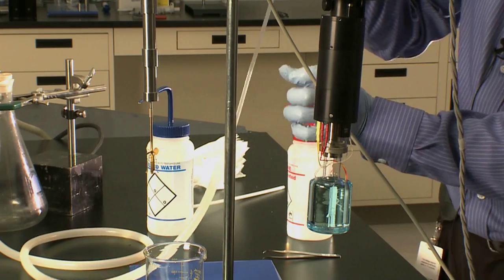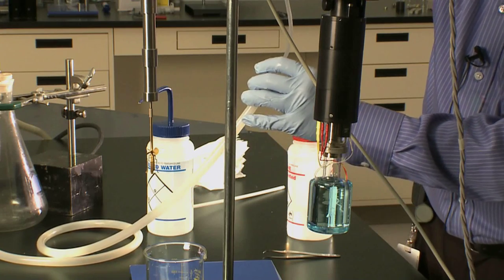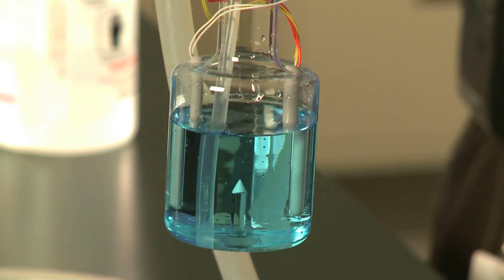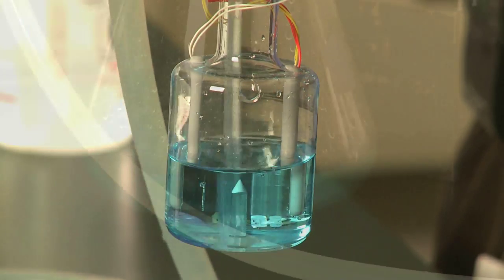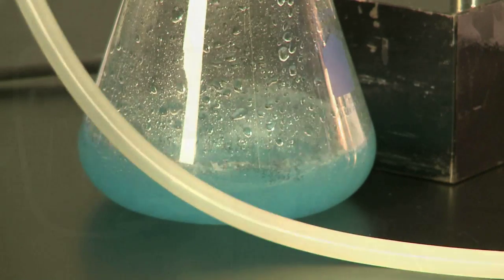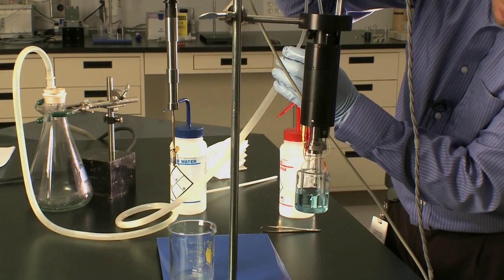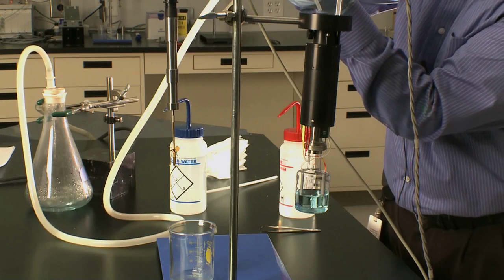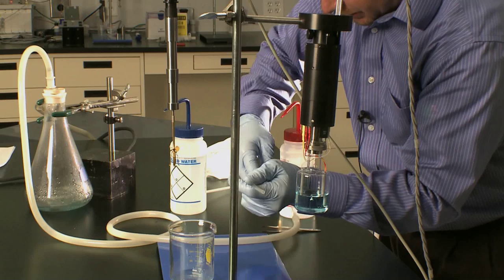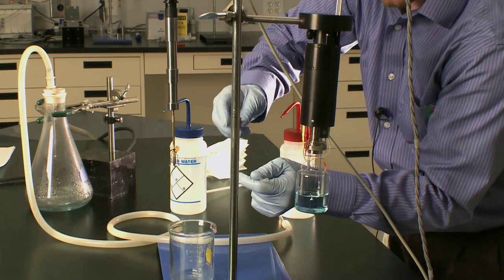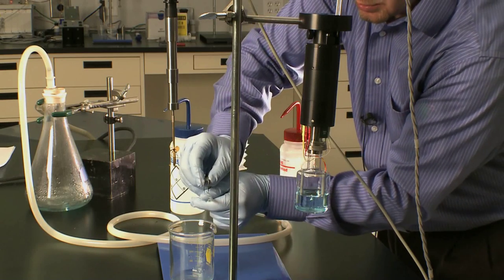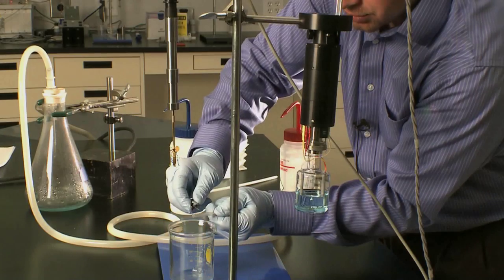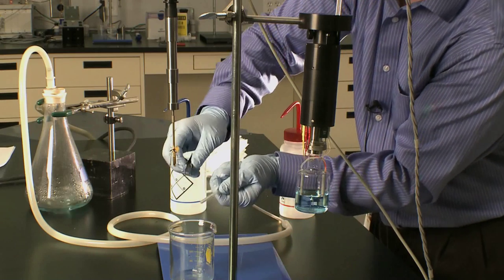You'll have little glass fragments down on the end of your solution calorimeter vessel. Take out the majority of the solution and fish around with the silicone rubber tube. You'll see that at the end of the tube, you'll lose some suction because I have little glass pieces on the end. These glass pieces are very sharp and very thin, so you may want to use the little tweezers to remove them and pinch off the vacuum tube so that they'll just fall off the end.